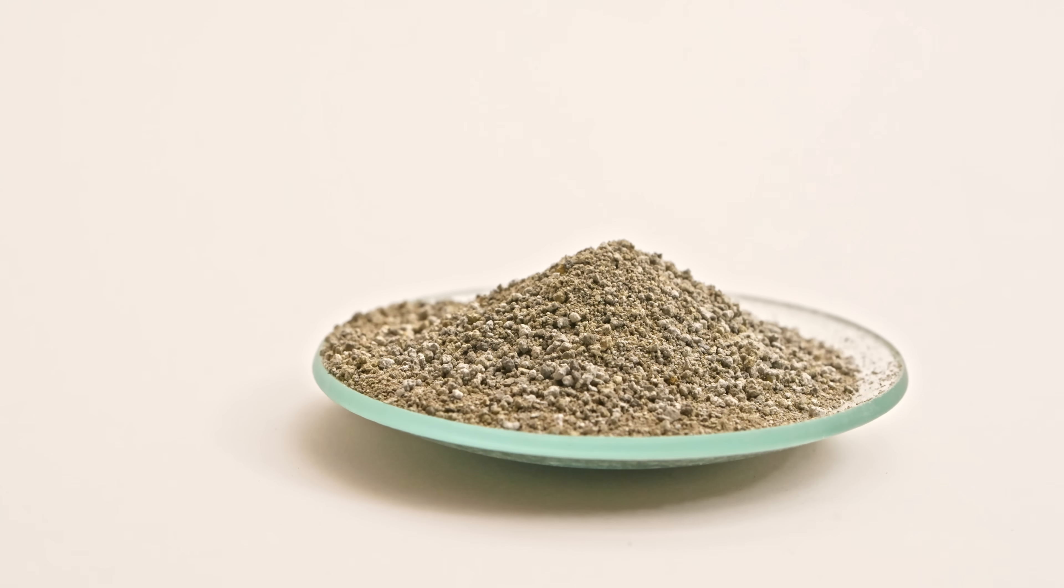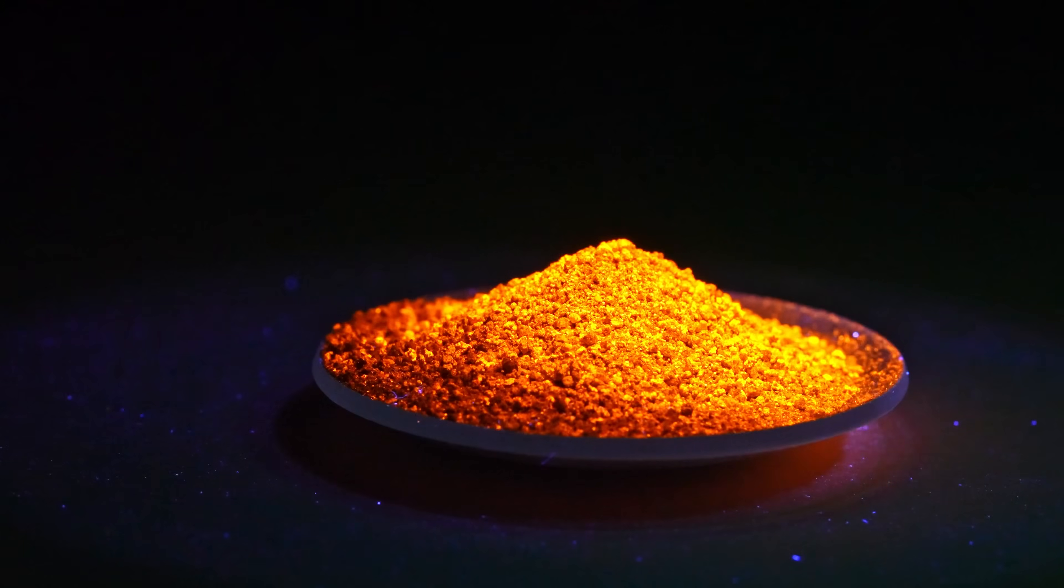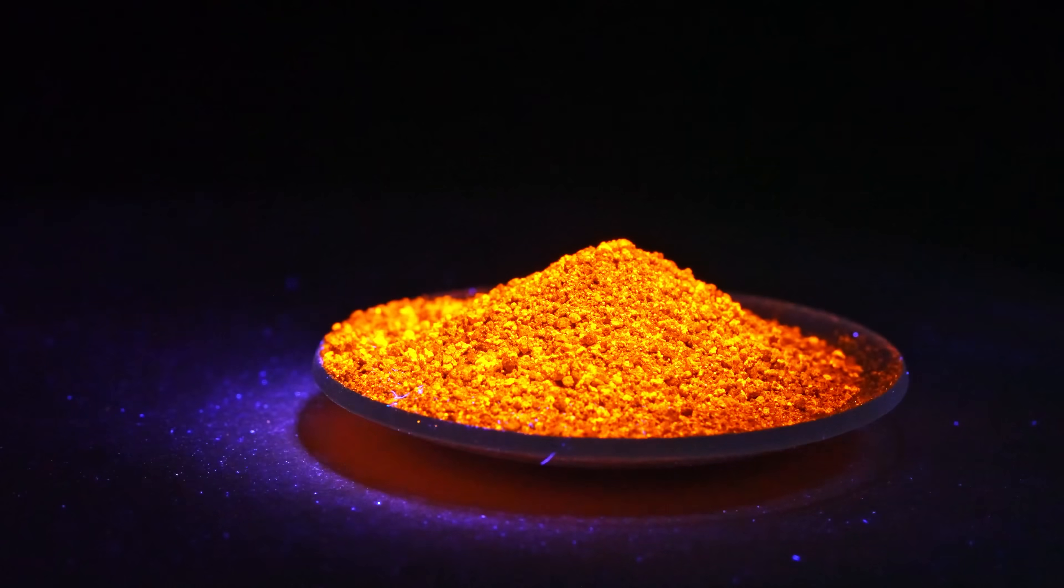Now, I'll shine an ultraviolet flashlight on the magnesium nitride powder, and you can clearly see it fluoresces with an orange light.